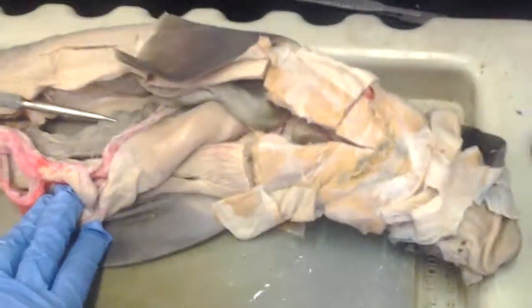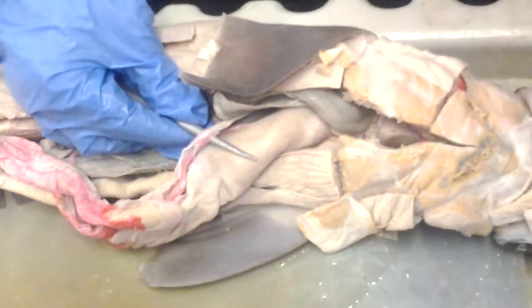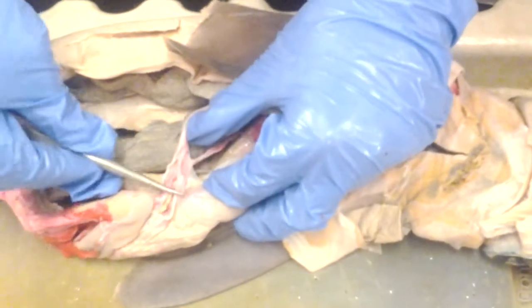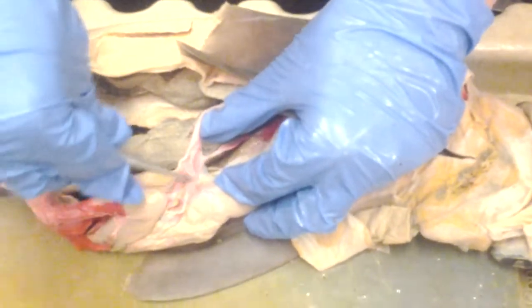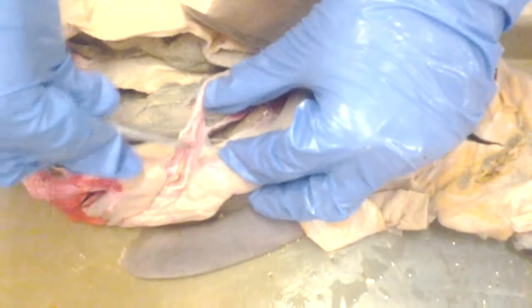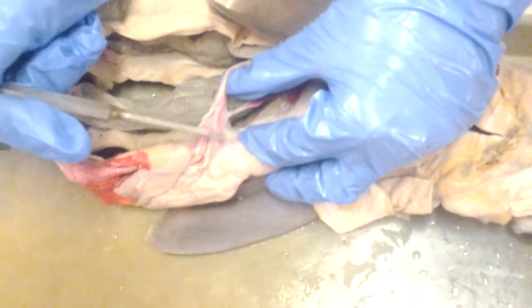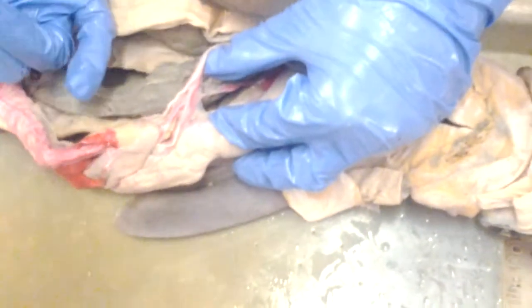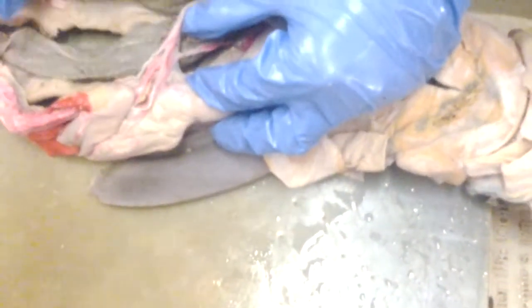Let me show you. Yeah, so the top part is the gastrohepatoduodenal ligament. See how it splits into two? So it's going to split into two here. Here's one side, here's the other side, so it's Y-shaped. This is the side that goes to the stomach, the gastrohepatic ligament. The other side goes to the duodenum, and it's the hepatoduodenal. So just remember that gastrohepatoduodenal ligament comes from the liver.